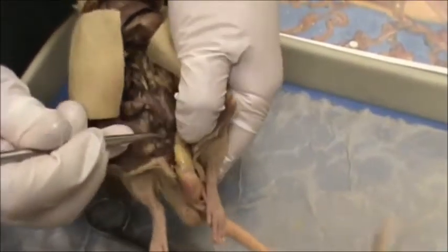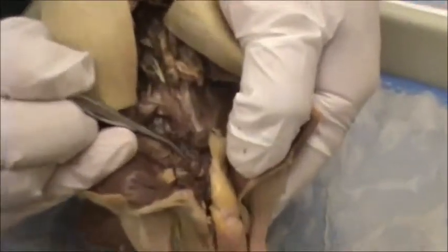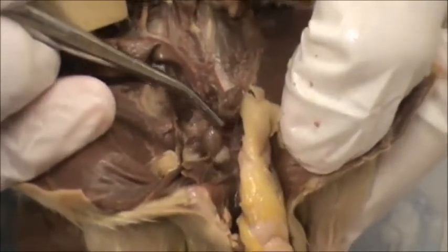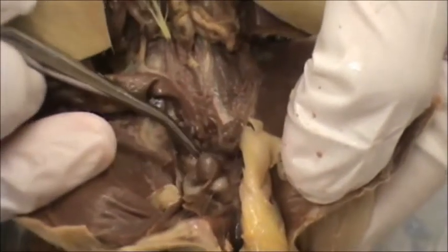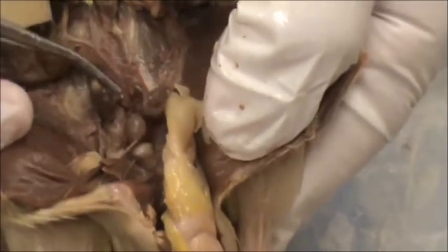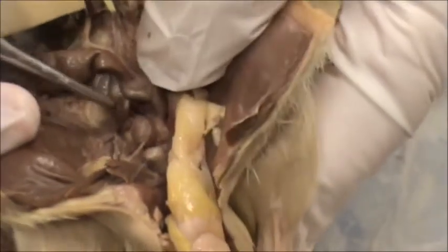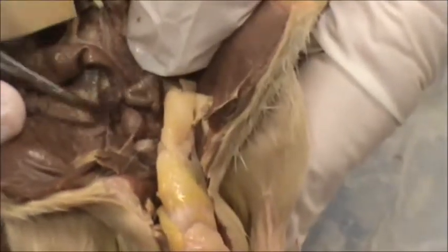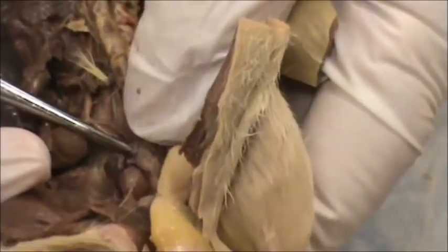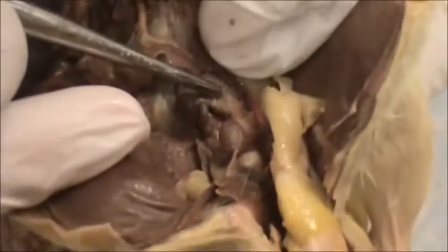This is the male reproductive organs. Right here is this little tiny stub, and that's the bladder. The bladder can be filled up larger and look like a balloon, or it can be empty and look like this little stub. Behind it are the vesicular glands, or the seminal vesicles as they're known in the human. There's also the coagulating gland right here, but it's very hard to see.